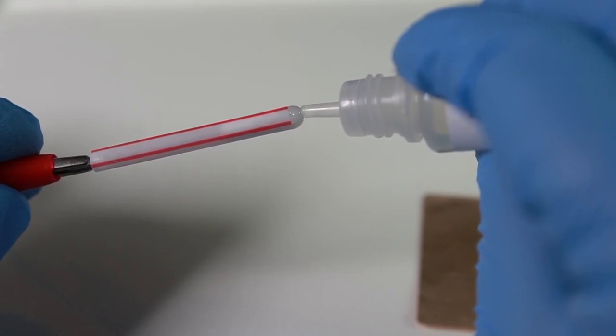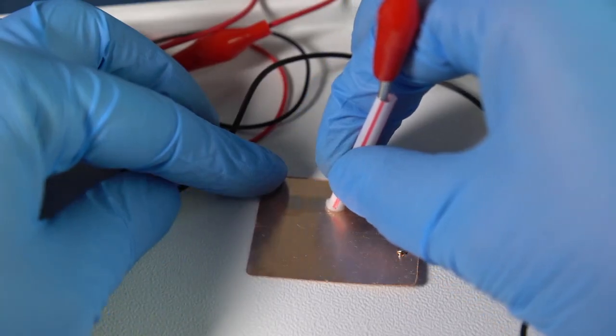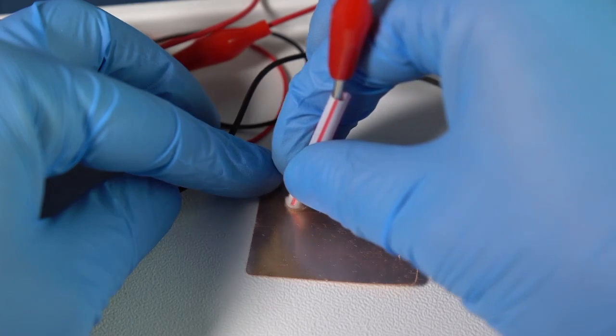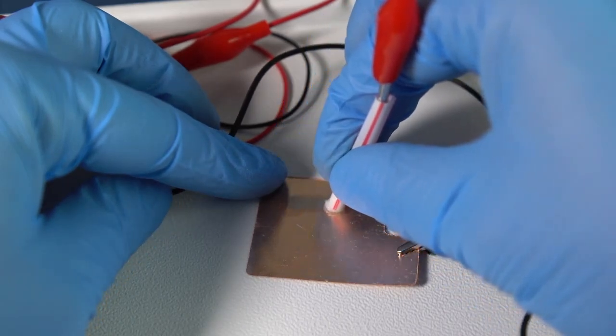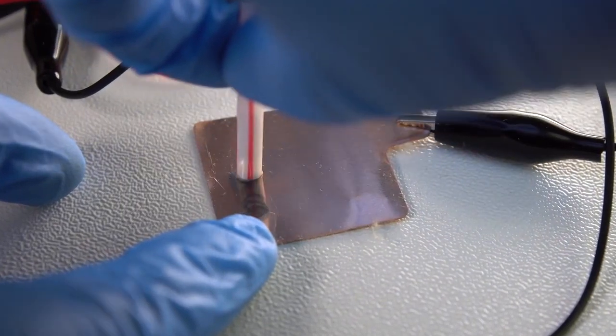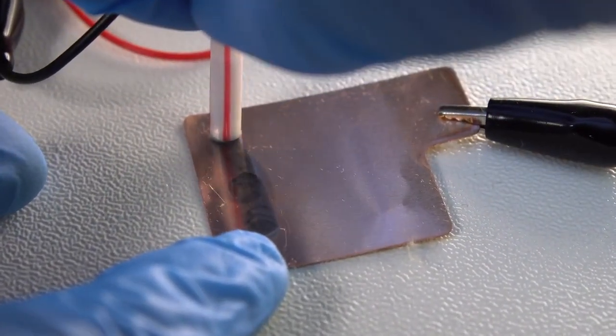Slowly move the pen on the surface of the copper plate. As you can see, the improvised pen does really act as a real pen, but it has metal zinc ink instead of pen ink, which makes shiny marks on the copper plate.